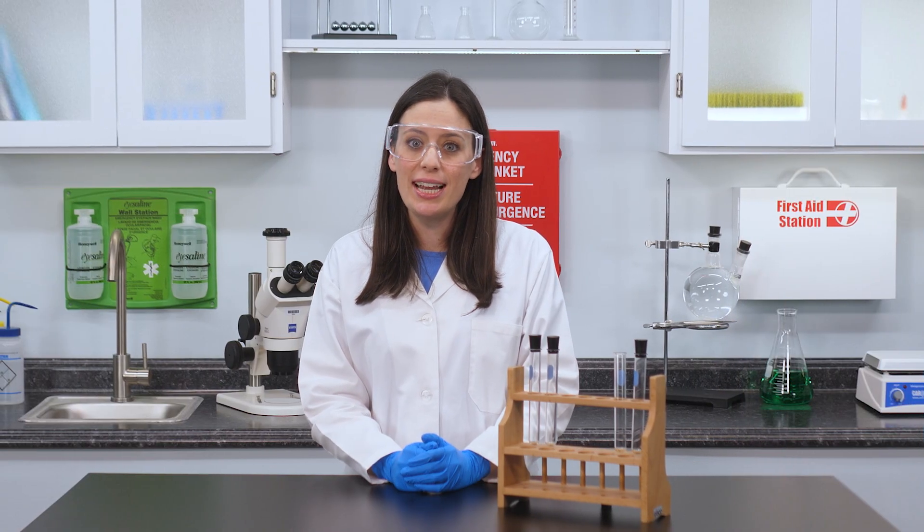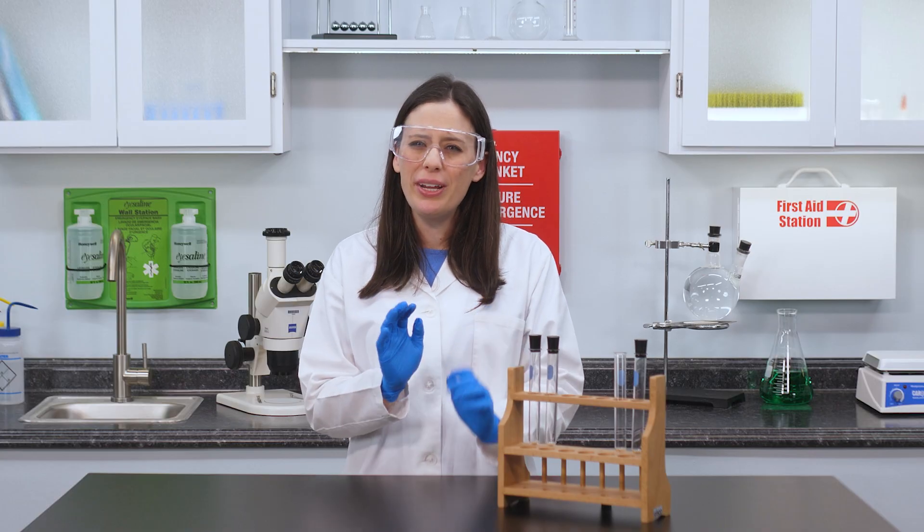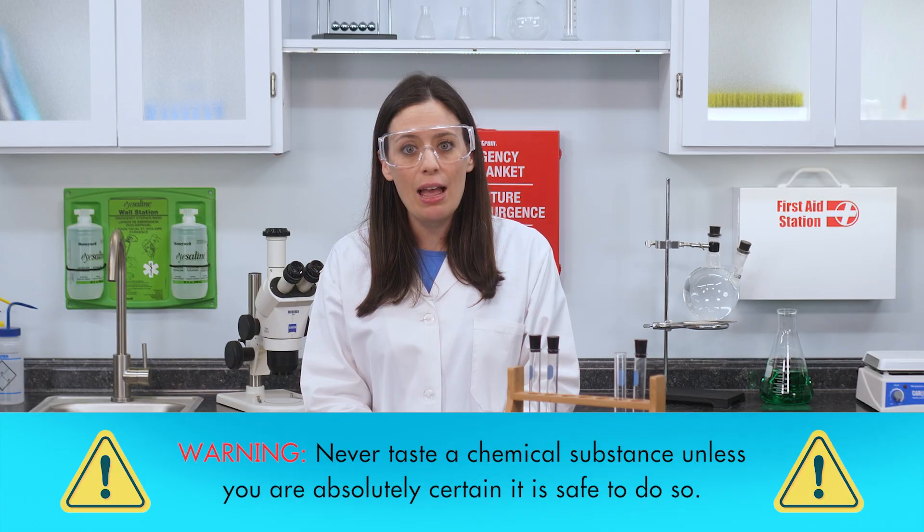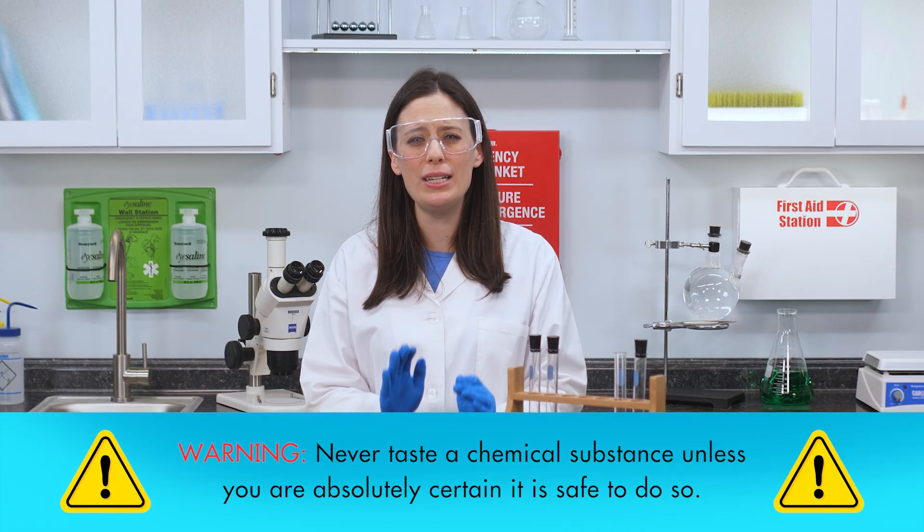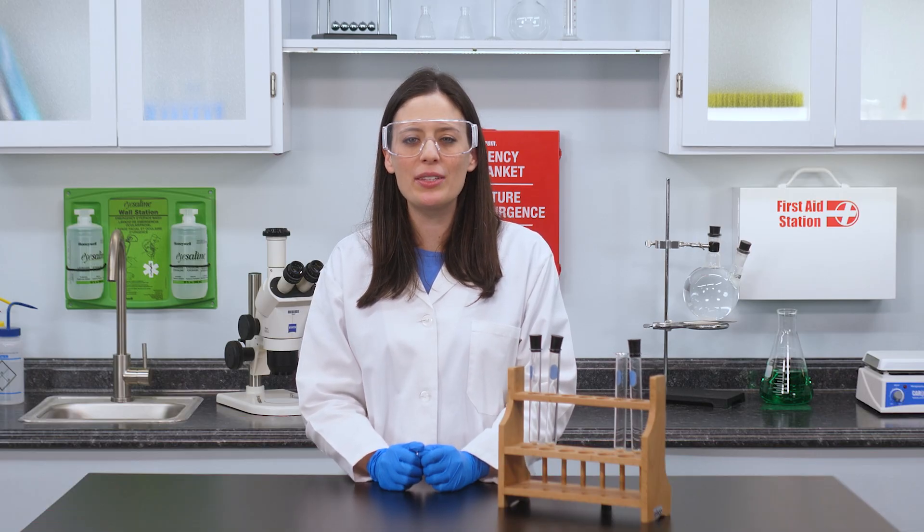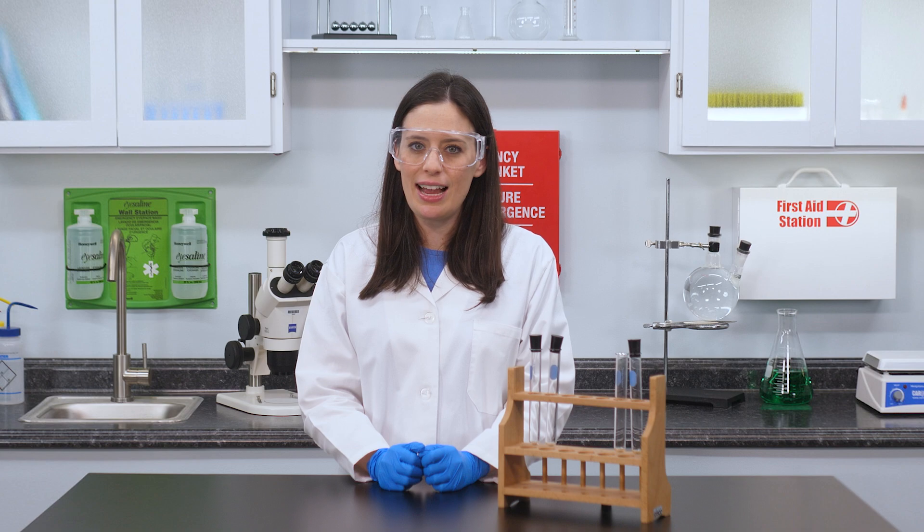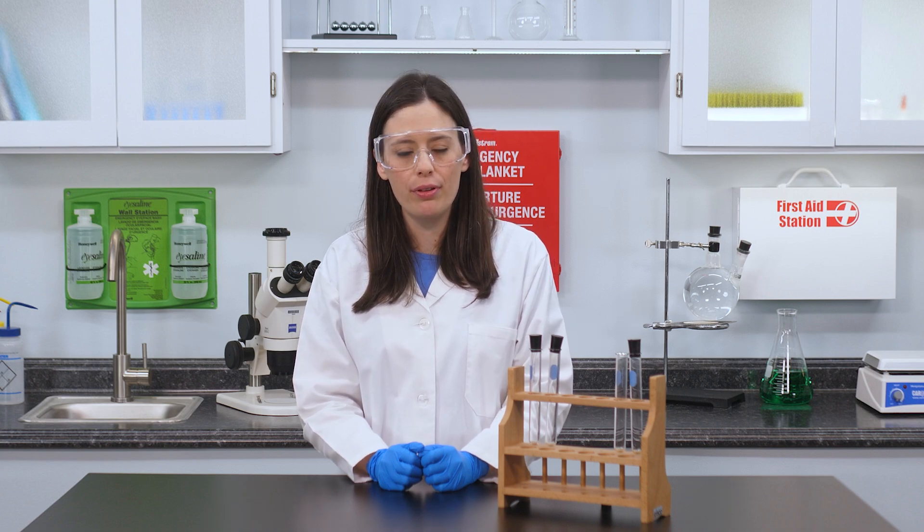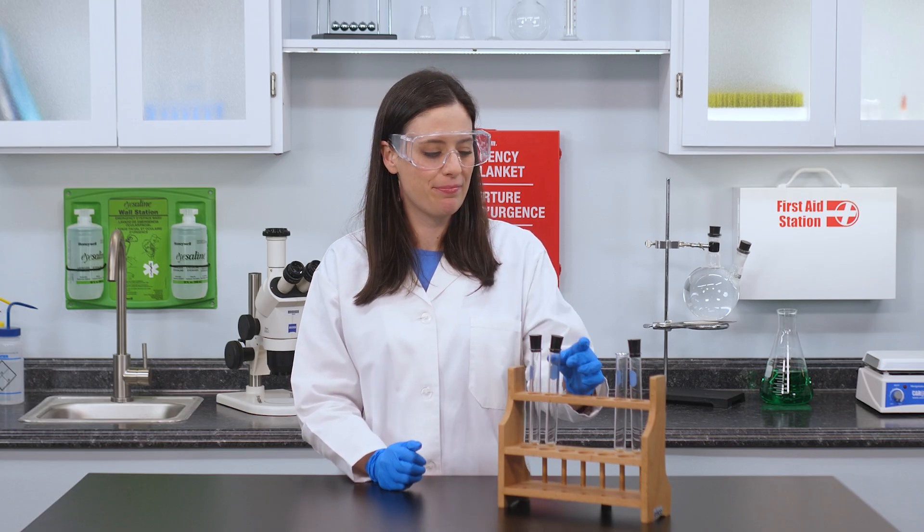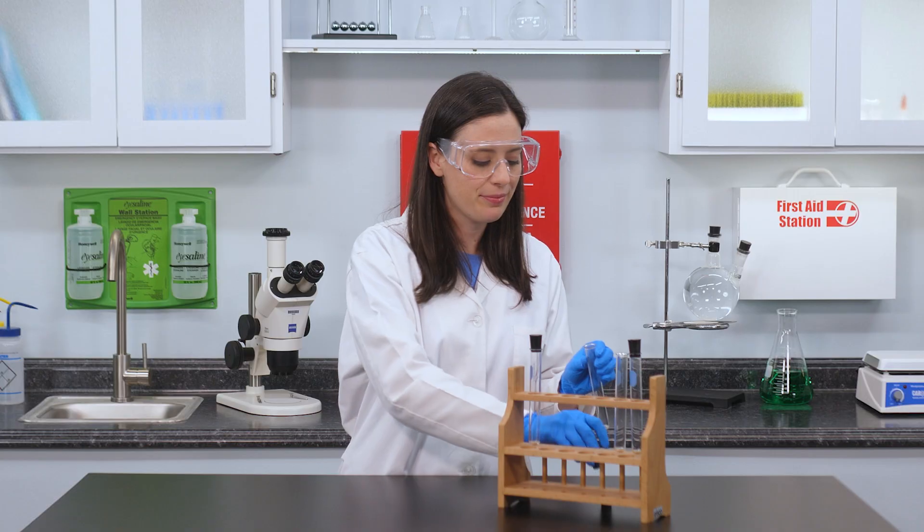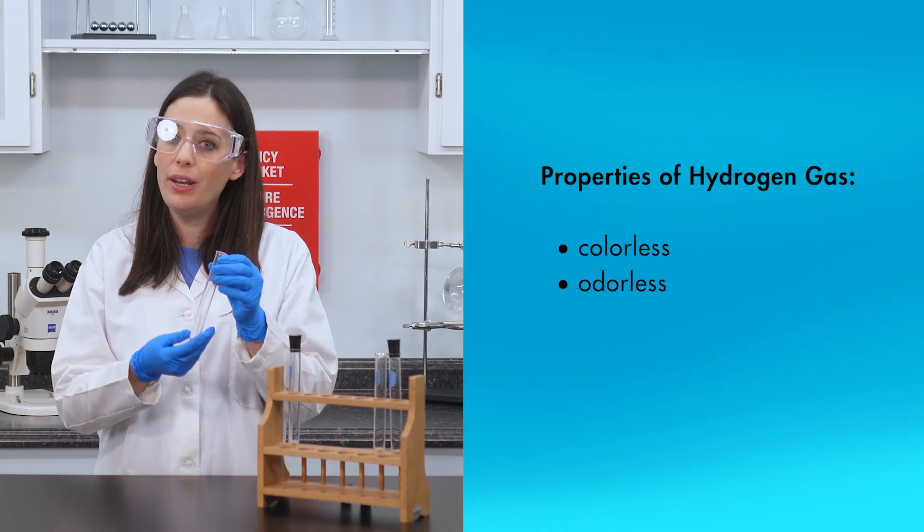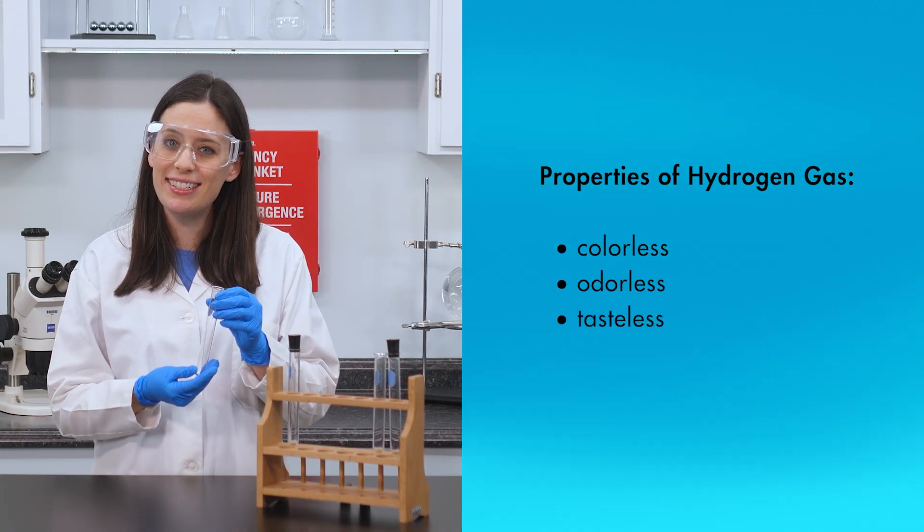Some substances can be identified by their taste. However, we offer a similar word of caution. Never taste a chemical substance unless you are absolutely certain it is safe to do so. We will follow a similar procedure as we did with smell, but this time we will inhale some of the gas through the mouth. If the substance has a taste, we should be able to detect it. We notice that hydrogen gas is also tasteless.